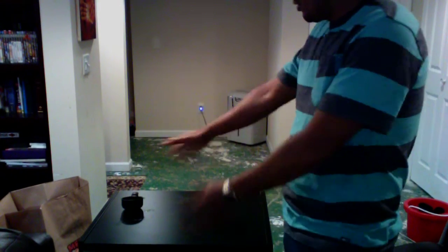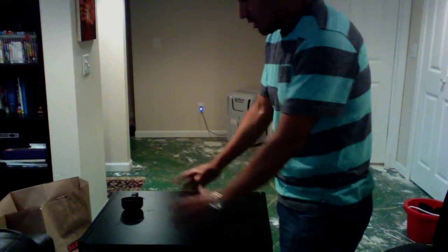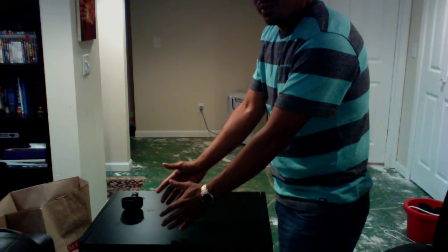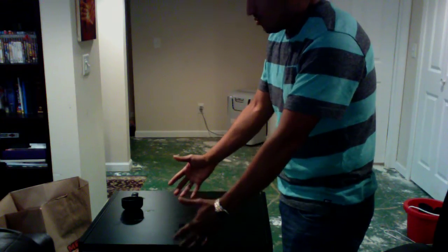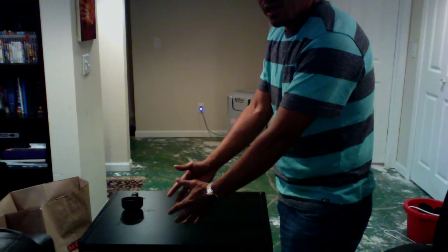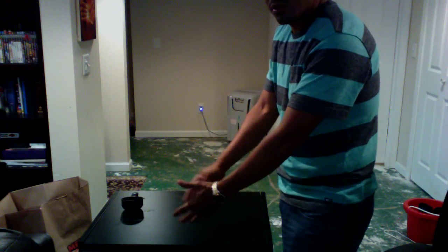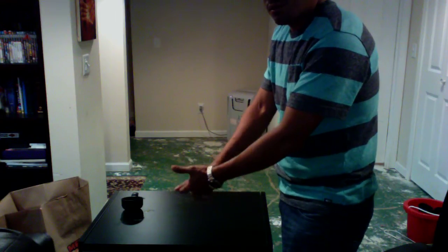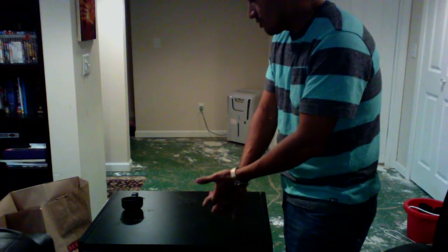And we sit it here, and that's when the fun begins. You see the foam coming out. It's spreading all over the place, making a big mess. But here, when we touch the bottle, it's hot. That's an exothermic reaction. The combination of those ingredients creates heat. If you think about it, this soap, yeast, hot water, the hydrogen peroxide, everything has created this fun foam and also some heat. And that is what an exothermic reaction is.